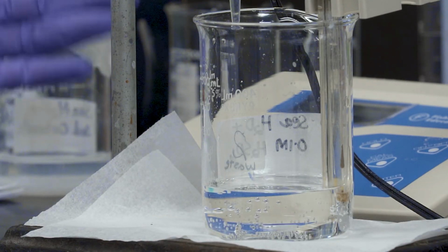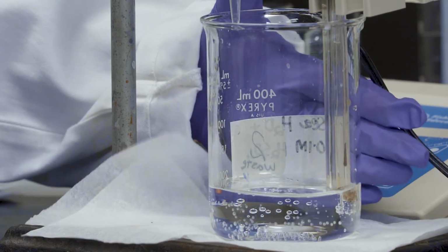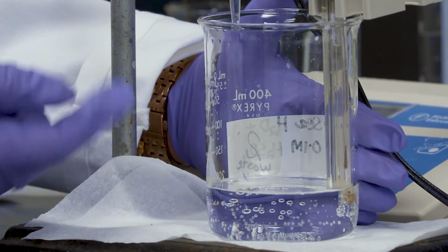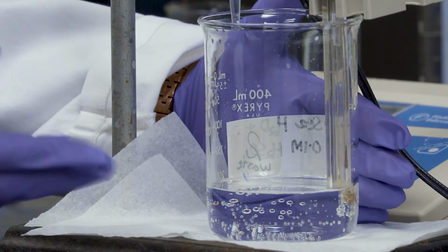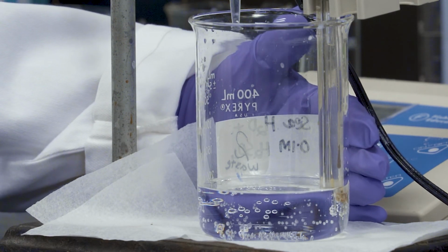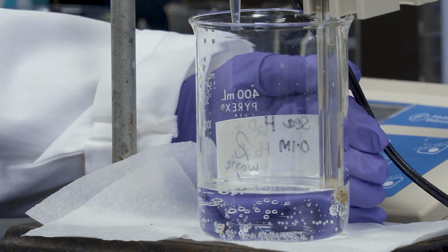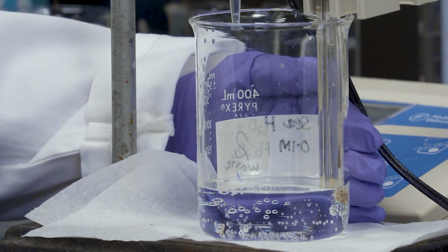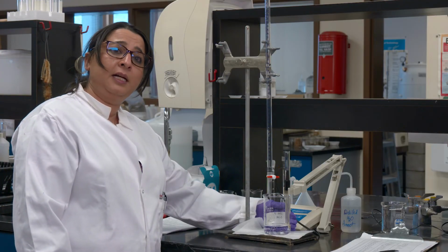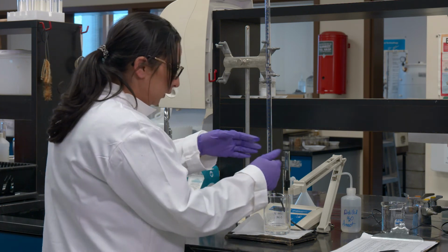So we just hit the pH below 4. I'm at 3.6. So if we can zoom in, you will see more bubbles have formed since last time we saw. And even if you see the probe, bubbles are forming there just so that you guys can see in here. So we are becoming acidic and we are close to forming CO2 here in our solution. So what I'm going to do is, I'm at a reading of approximately 3.37. I'm going to give it another ml and we're going to be below 3 and see what the reading is, and then we'll go from there.